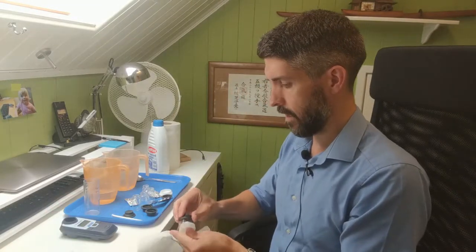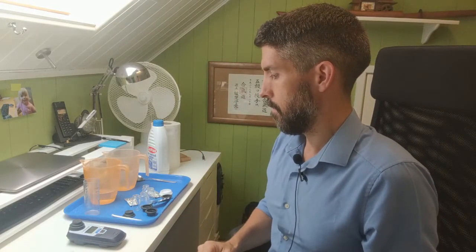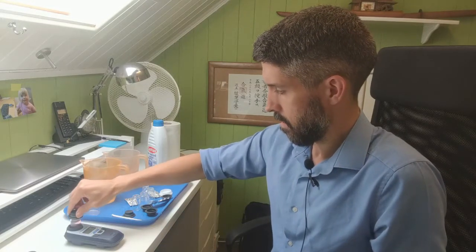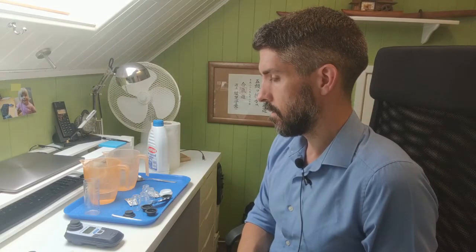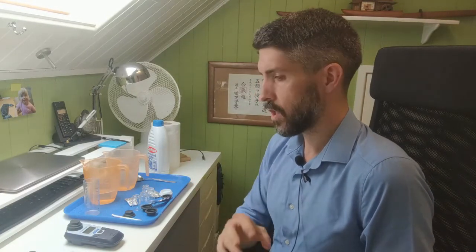So let's put the blank in the photometer so we can zero it. And then put the actual sample in. And let's see what we've got. It says 0.65, but because of that bleaching effect that we saw, we know that that's inaccurate, because when we only had just a few drops of water, we saw a very deep, very, very dark pink, and we actually observed the water bleaching the DPD1 tablet as we added it up to 10 ml.